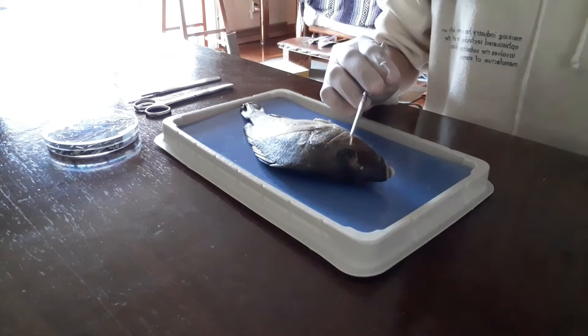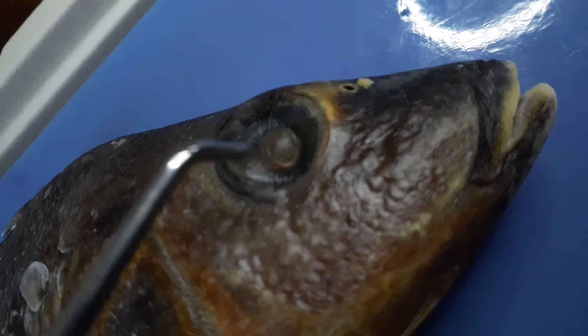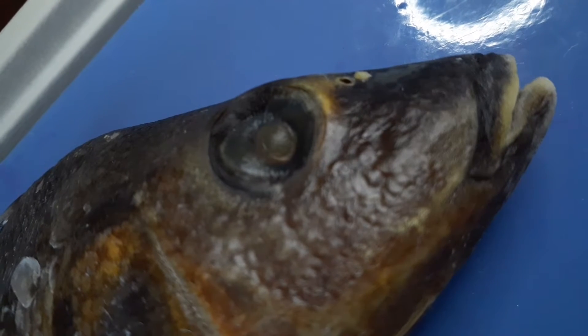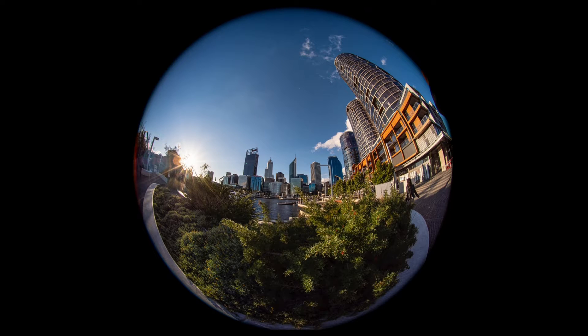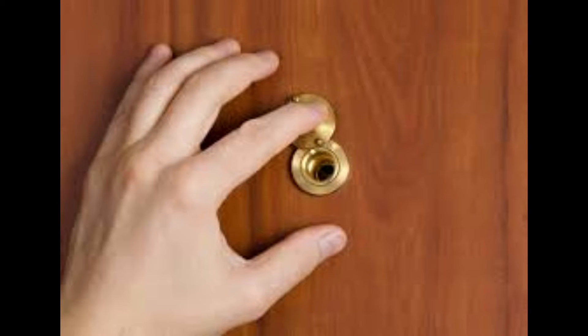Right here are the eyes. They help the fish with almost a 270-degree angle view. It's really cool, and here are a few pictures of what the fish sees — these pictures represent how fish see the world around them. Also, your front door peepholes are based off the fish's eye.